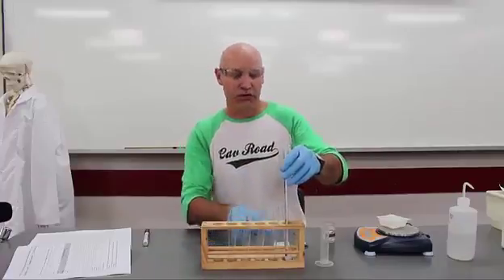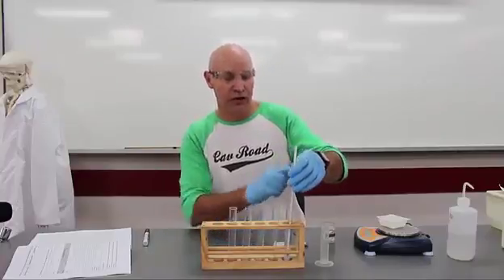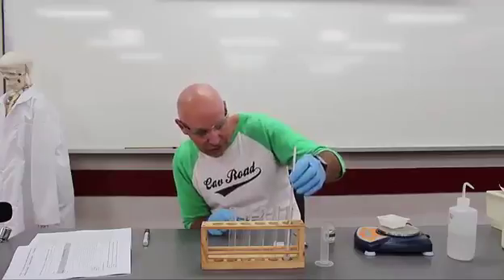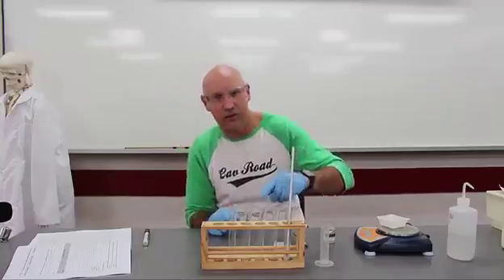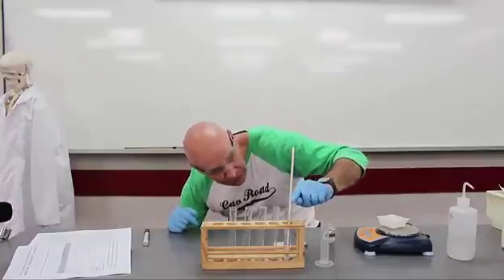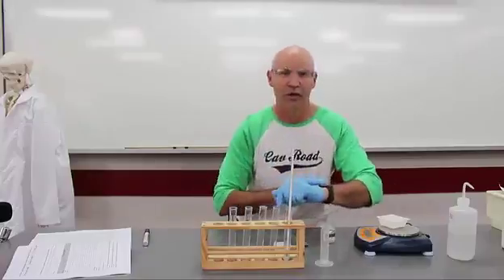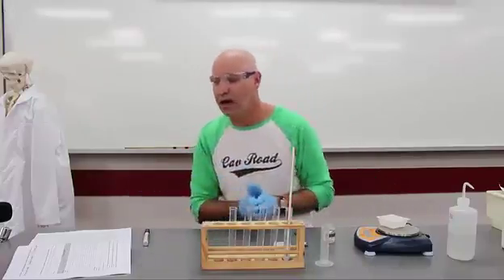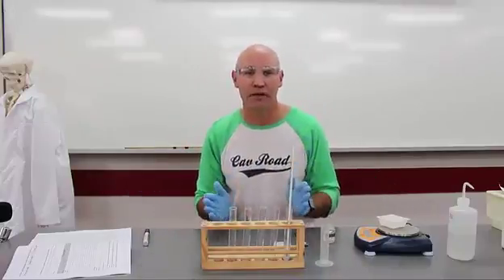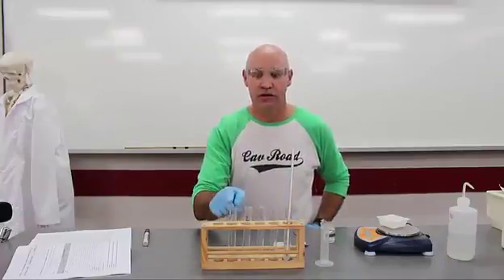It's going to be important obviously that you don't touch the bottom of the test tube. Have a think about why you wouldn't do that. Okay, that's 30 seconds and the temperature has gone down, so I'm going to write that temperature down. Again be aware of that parallax error, and get down low and look and write that temperature down straight away, and then monitor for the next 30 seconds. Again do that. I want you to repeat that for 5 minutes, and you're going to repeat exactly the same thing for each of your test tubes.